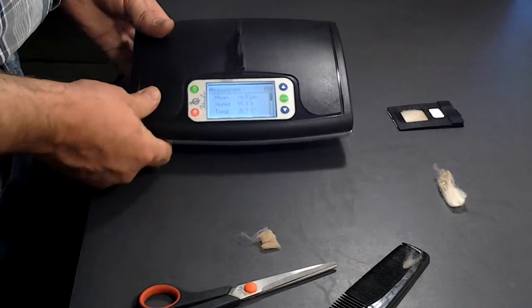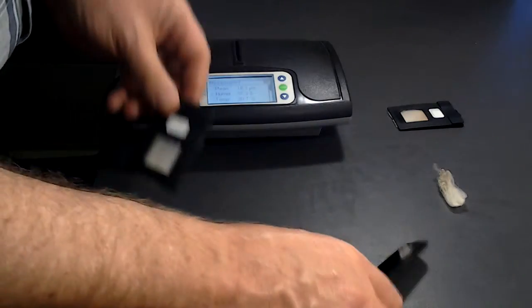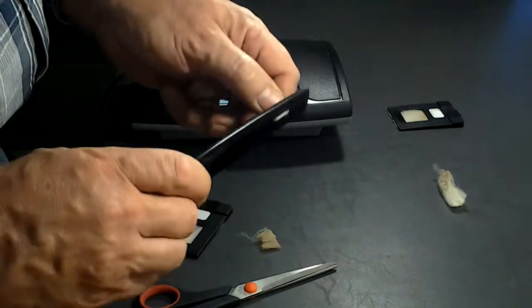There you go, 18.3. In between, please clean your comb.